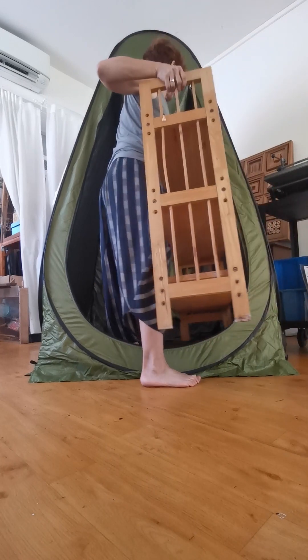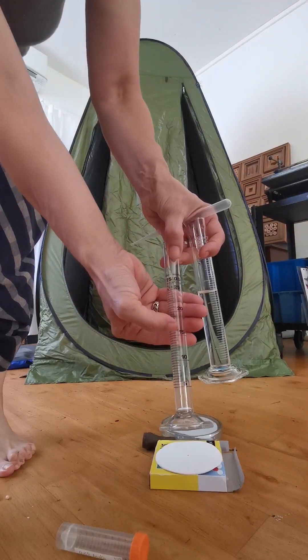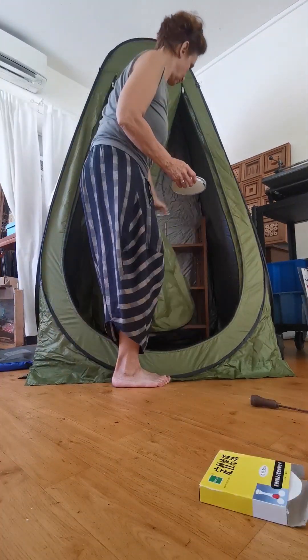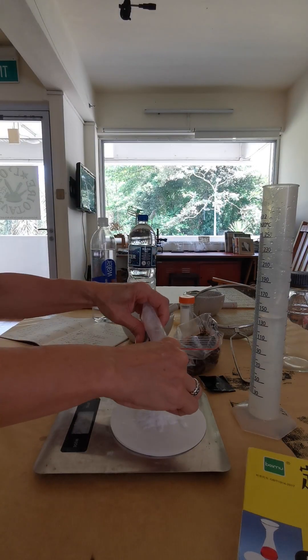Prepare your dark room. In there you will make your silver nitrate solution with 15 milliliters of 1 molar silver nitrate and 35 milliliters of distilled water — in the dark, so you can use a red light. Then place your silver nitrate in a small Petri dish and your filters inside each Petri dish.